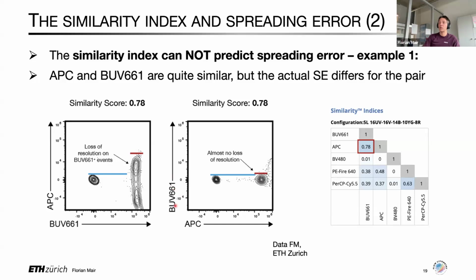And as such, this would be a pair if you were to use it that way around, let's say for APC to stain your CD4 and BUV661 to stain a chemokine receptor, in all likelihood, you're going to see nice separation. But if you were to try to do that the other way around with CD4 on BUV661 and your chemokine receptor on APC, you probably have no chance of resolving any chemokine receptor up here. Having said that, you wouldn't be able to see that from the similarity index because with those 2 fluorochromes, that's just the similarity index they have. But if you were to go back and calculate the good old-fashioned spreading error, you would have immediately appreciated that here there is a lot of spreading error, and here for this pair there is almost none, and as such could be used even for problematic pairs.